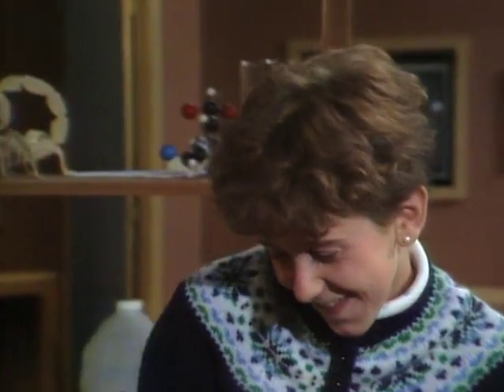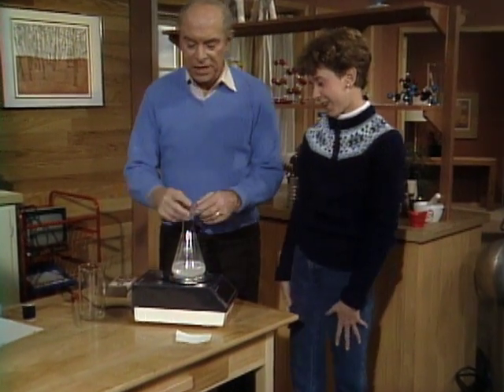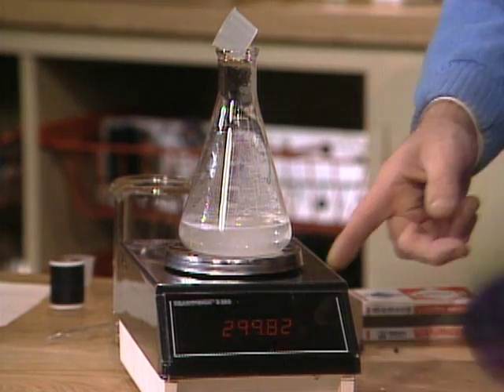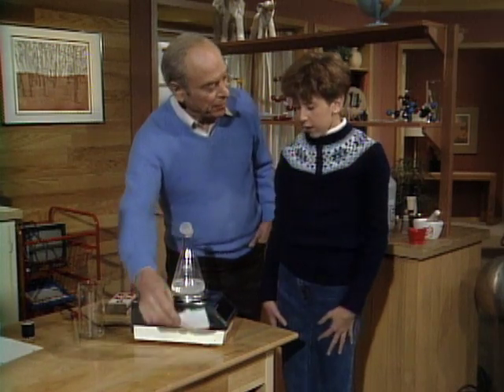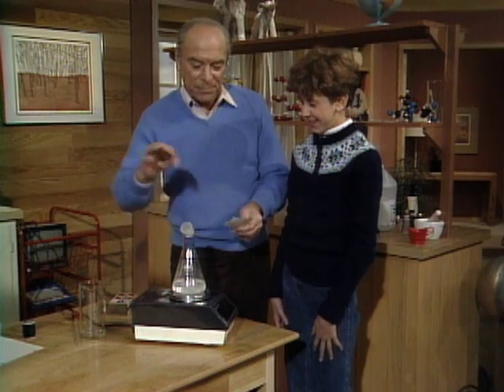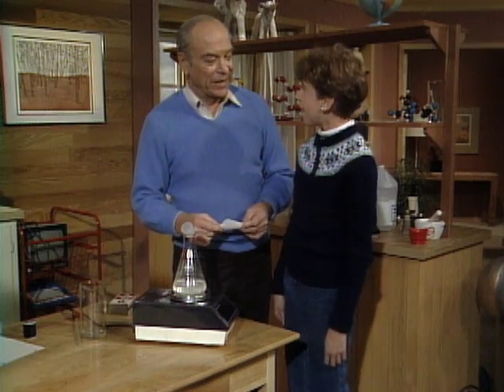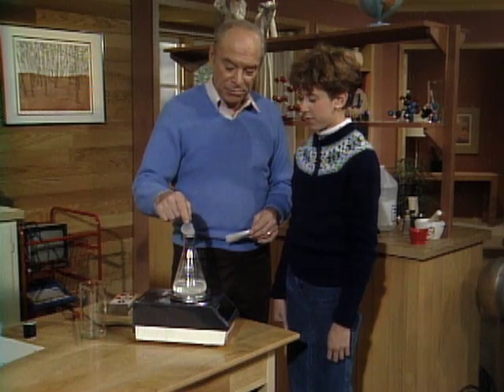It's popped off — wow, it hit you right on the head! Some of the gas is still being given off. I'll put the stopper back on. How much gas did you give off? About 0.5 of a gram. Remember how I had you weigh this piece of paper? And what was that? 0.5. So now, when somebody drops a headache tablet into water, can you tell them how much gas is given off? About 0.5 of a gram — because you were able to use a very delicate balance.